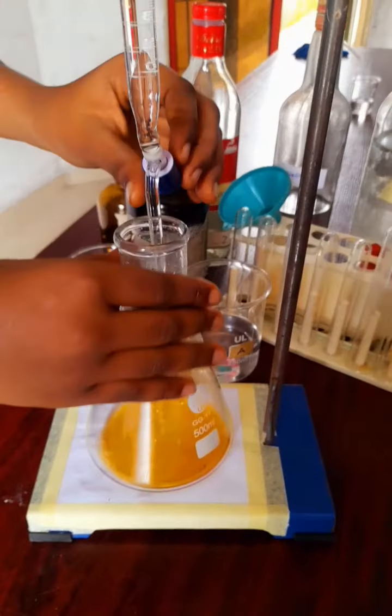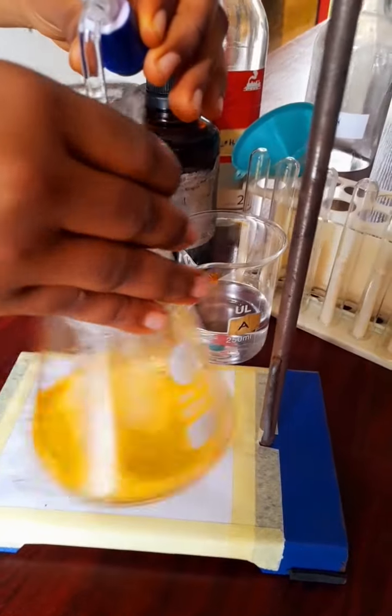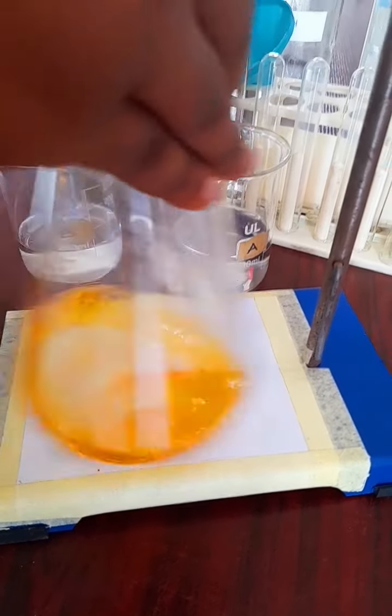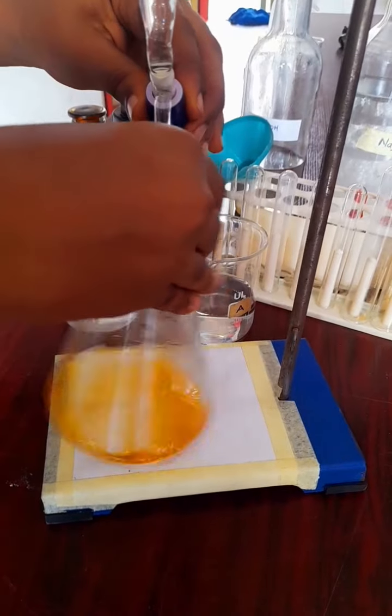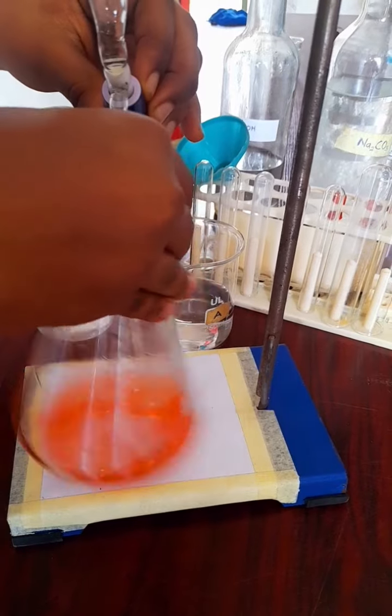All right, so let's go. We start adding the acid, the tetraoxosulfate 6 acid, into the trioxocarbonate. You see that when the acid drops, the color changes to pink, so we are sure that the acid has a good consistency. Then we continue the process. We swirl appropriately, so we make sure that the drops of the acid mix up completely with the whole solution of Na2CO3. We're going to keep titrating until we reach the end point where we see the color change, and that's about now.